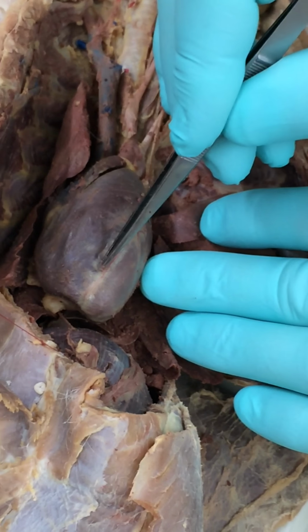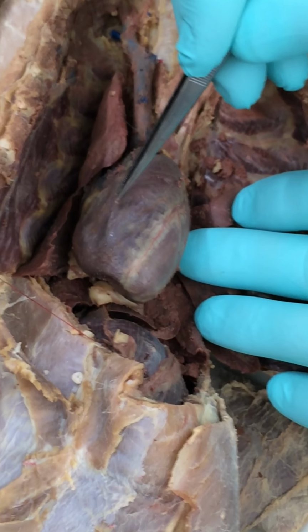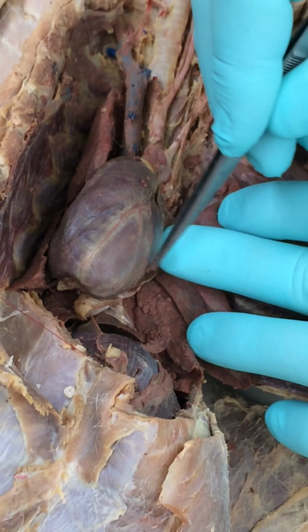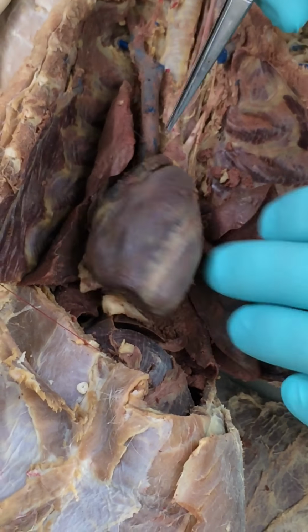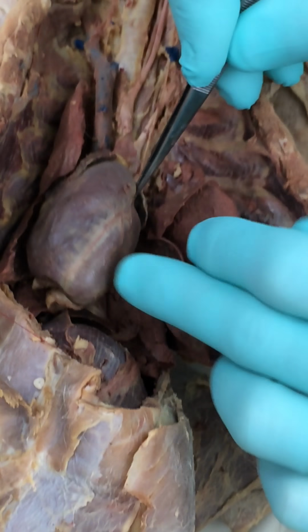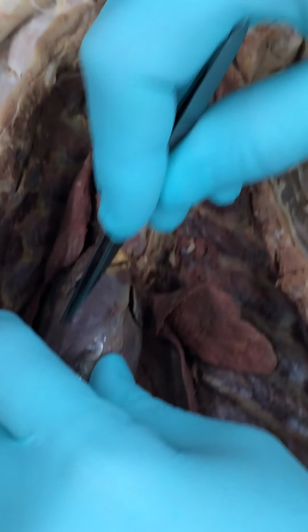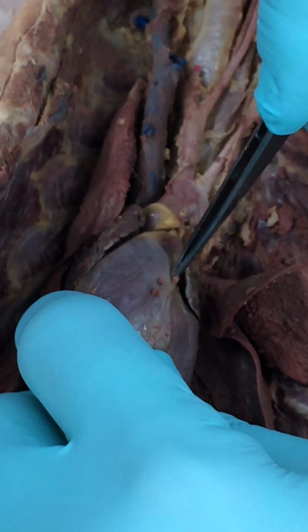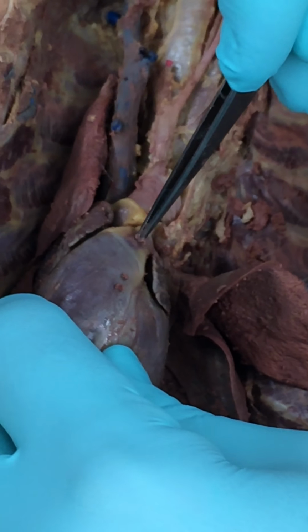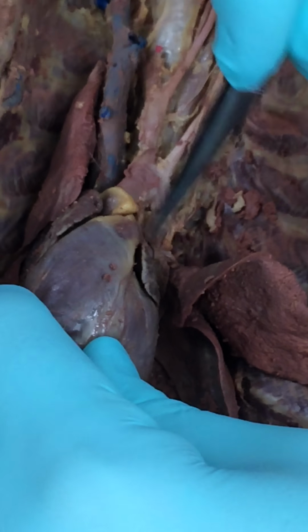Now, once you find the coronary vessels, you know the right from the left side. So this is the right ventricle. This is the left ventricle. That's the apex of the heart. Right atrium, left atrium. Now, between the right and the left atrium, there are two major structures. You have this, so the right ventricle comes up, it ends right about here, and then everything right there, that's the pulmonary trunk. Carries deoxygenated blood out to the lungs.